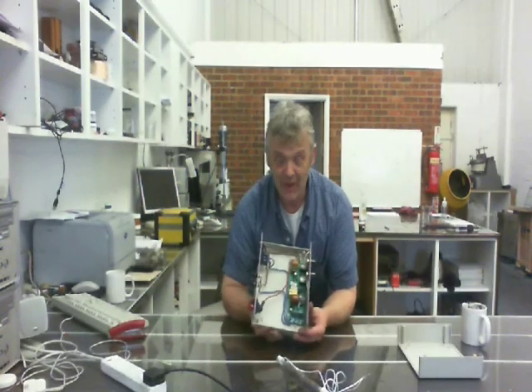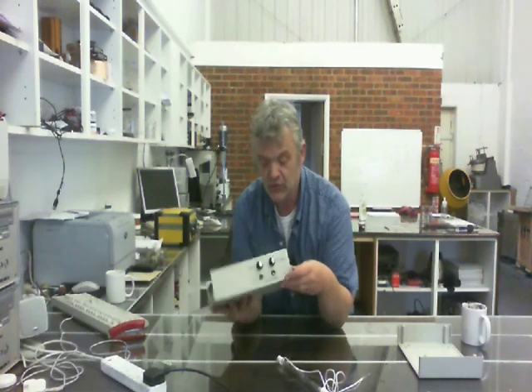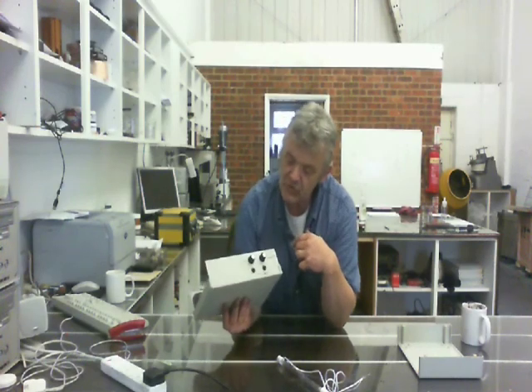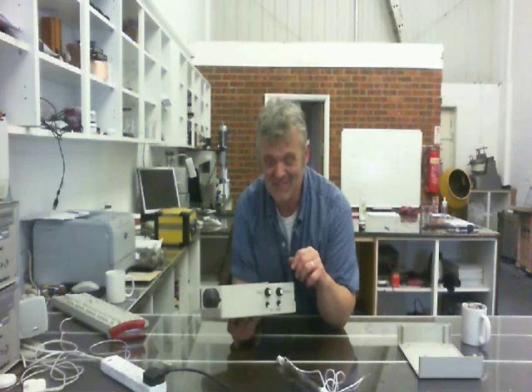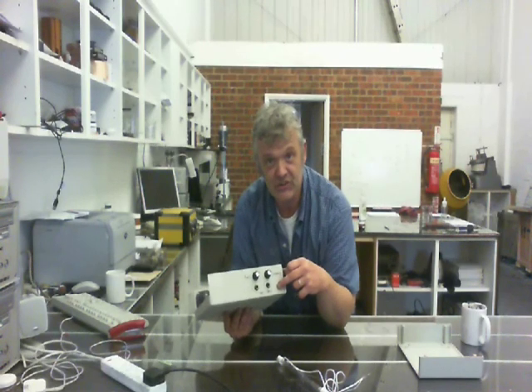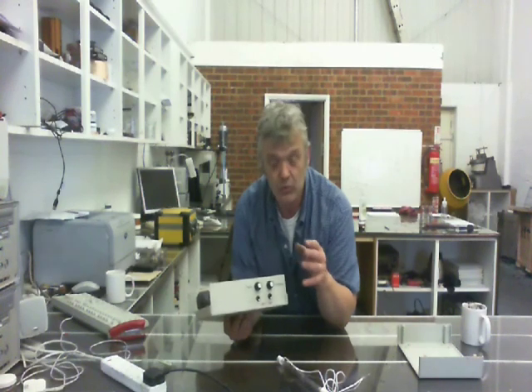Okay, so this is it put together, and you can see it's pretty simple. All I've done really is screw that board to the base plate of the box that I bought using some standoffs, drilled a few holes in the front cover to put the potentiometers through, and these potentiometers govern the rate at which it flashes and the intensity at which it flashes. I've written on what they are, because you can guarantee when you close the box, you're not going to be able to remember it. Now, this particular board will also take an external signal, so you can actually flash it to an output from something else, and you can also chain lots of these units together to create multiple units.